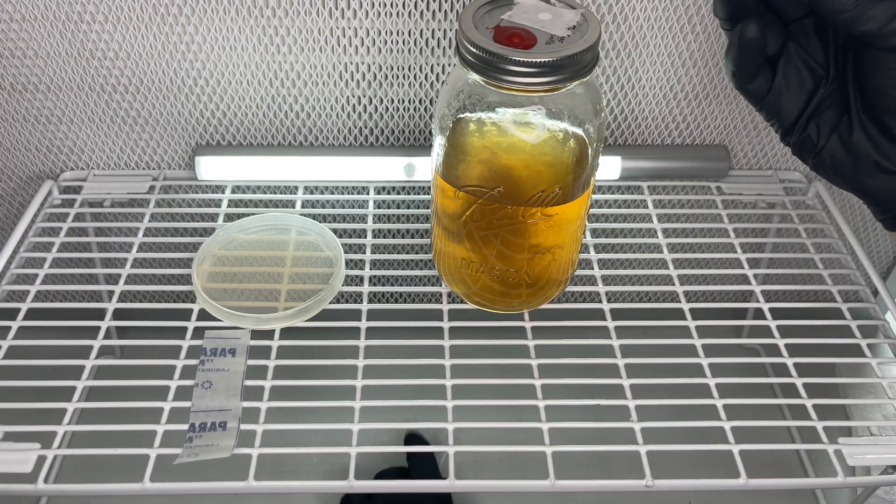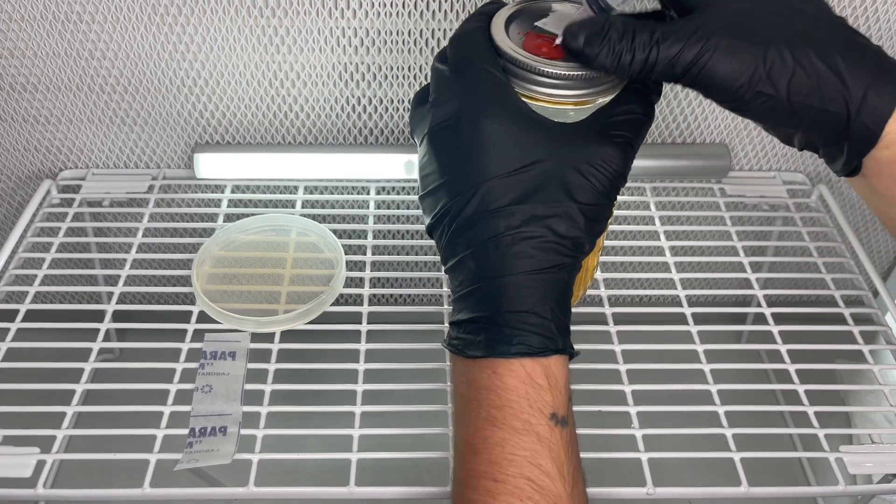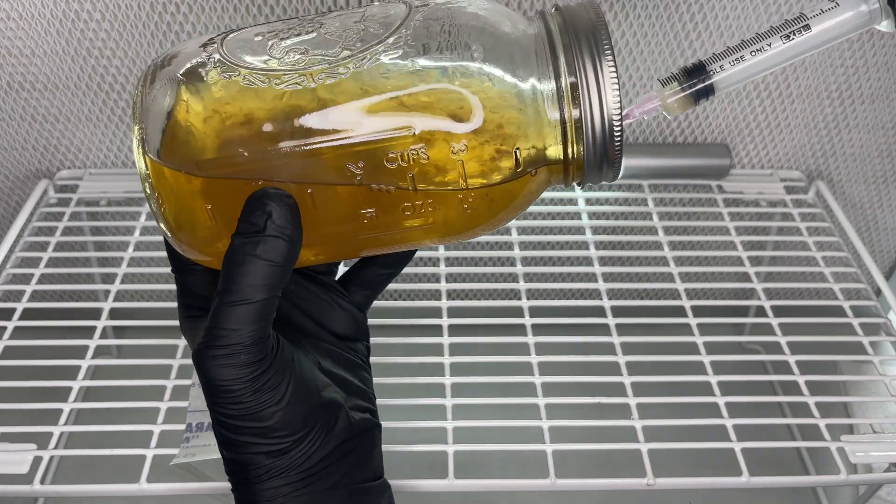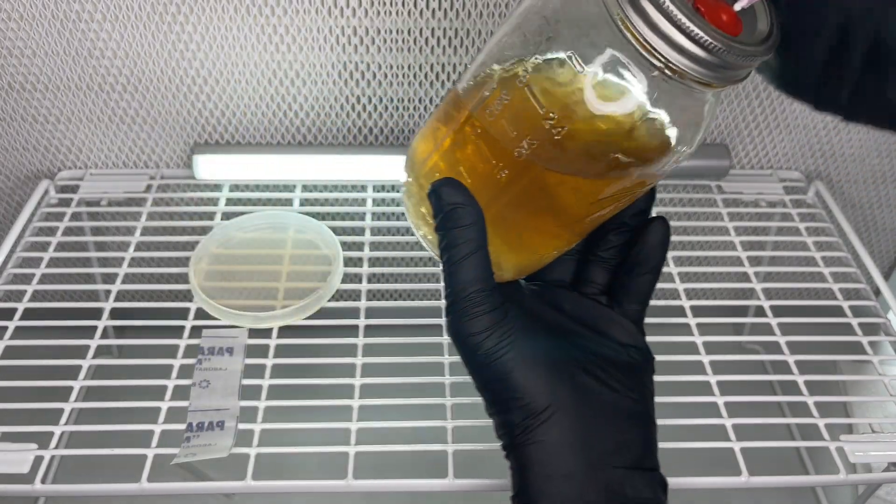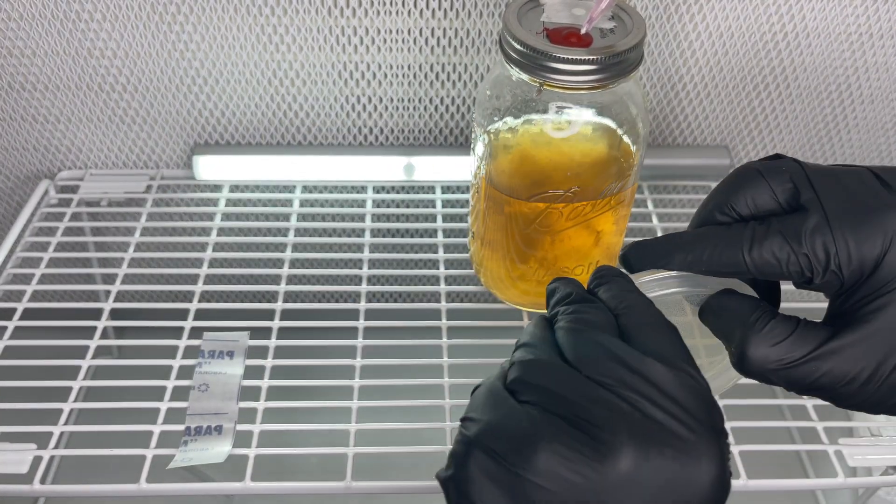That's why it's recommended to test one drop of the liquid culture on an agar plate. By doing this, the contamination will grow on the agar plate, letting you know that the liquid culture is contaminated and not to use it.